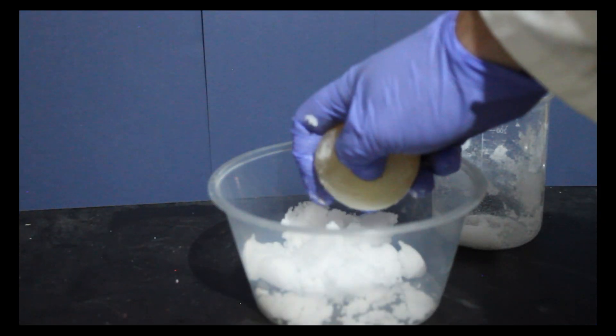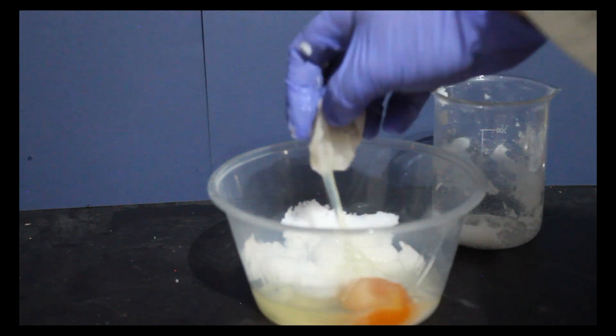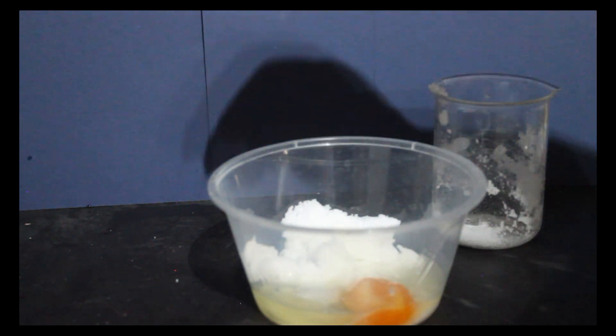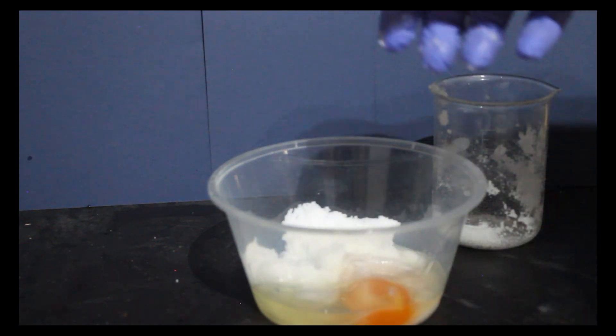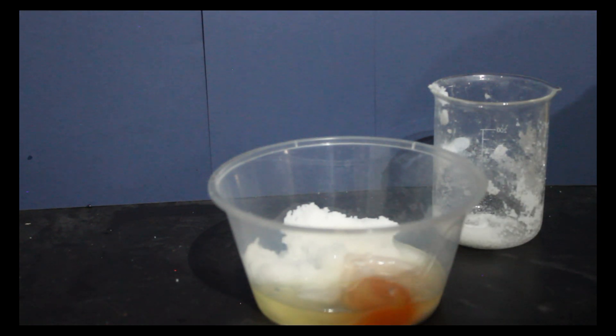And it's definitely not resistant to any pressure. Were our results what you would have expected from this experiment?